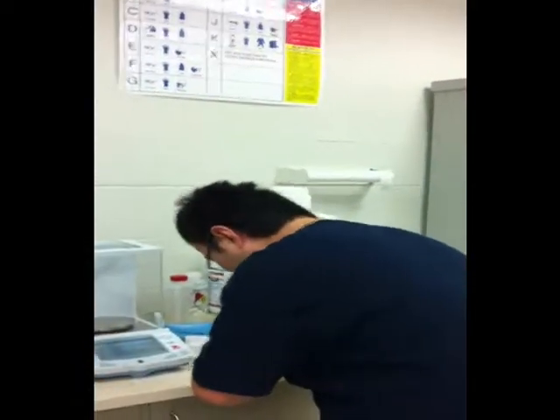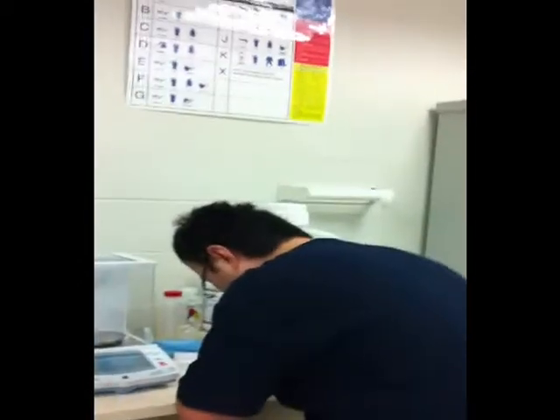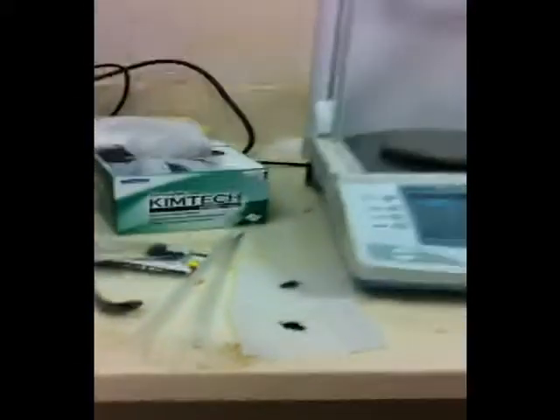Okay, so now this is my fellow Shu Chang, and he's actually going to mix this char and coke into this crucible over here. So I'll let Shu Chang do that.